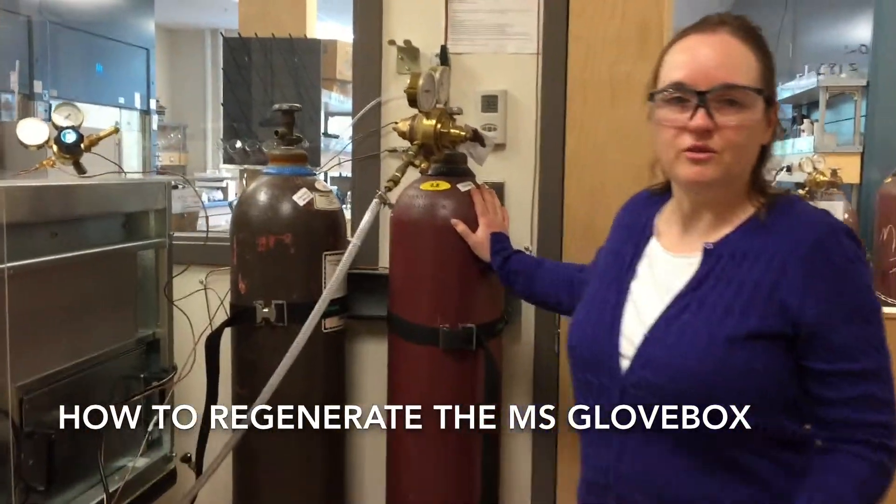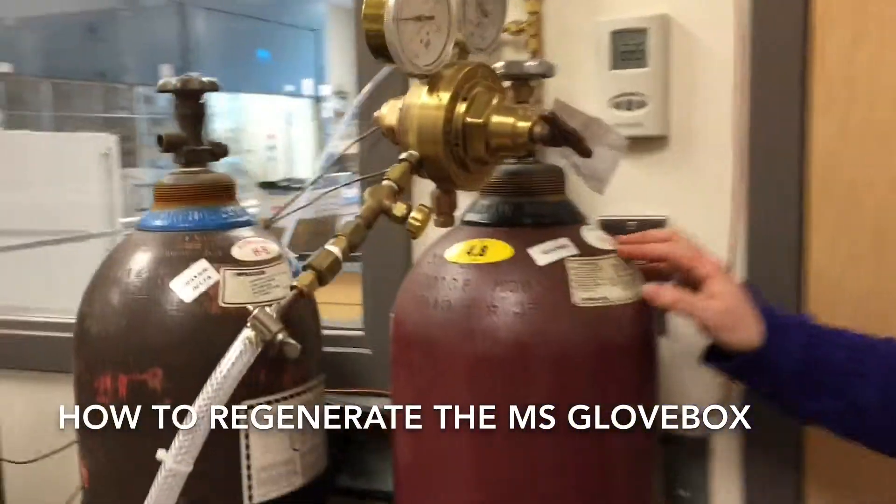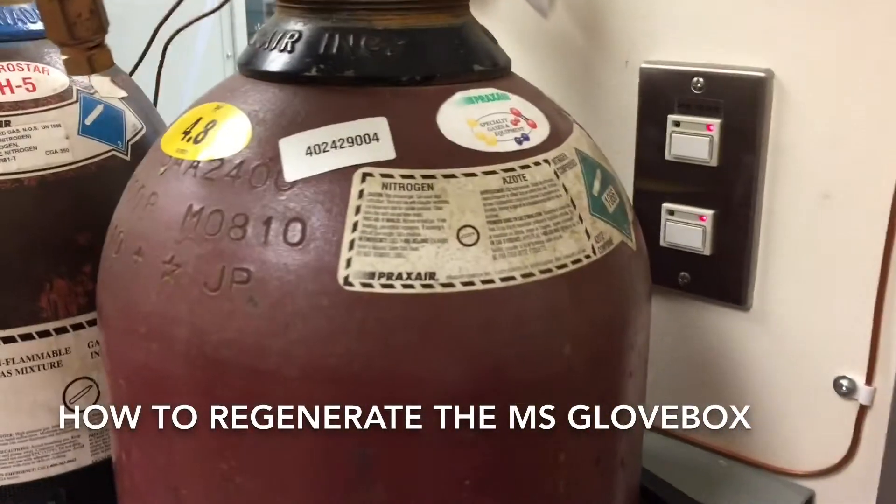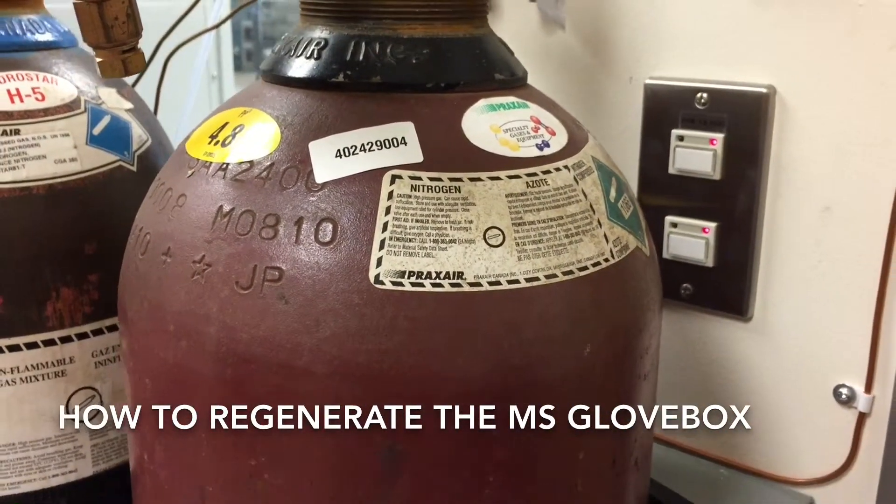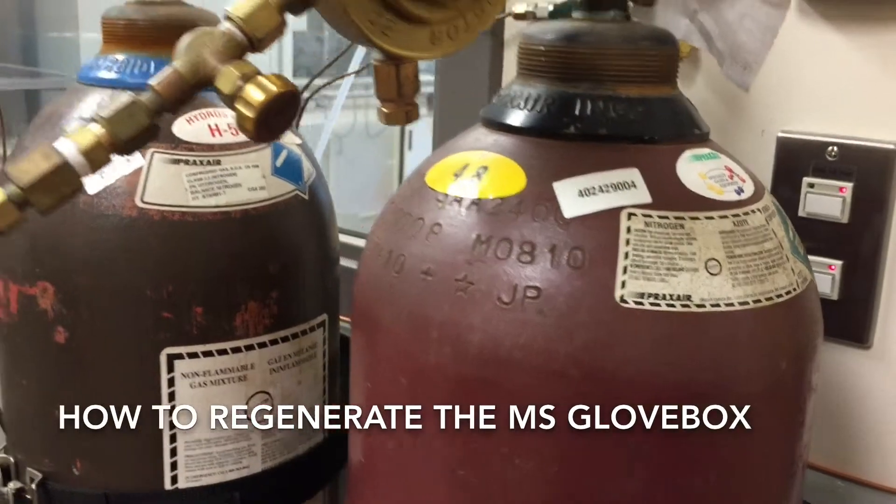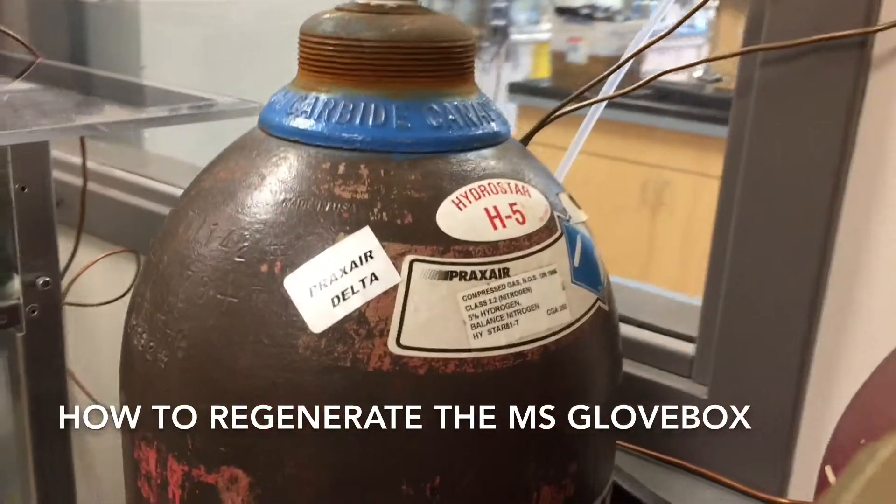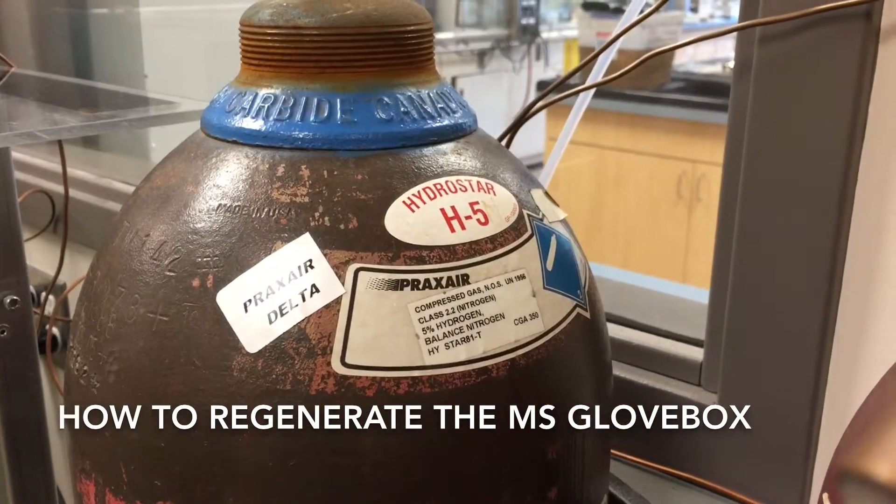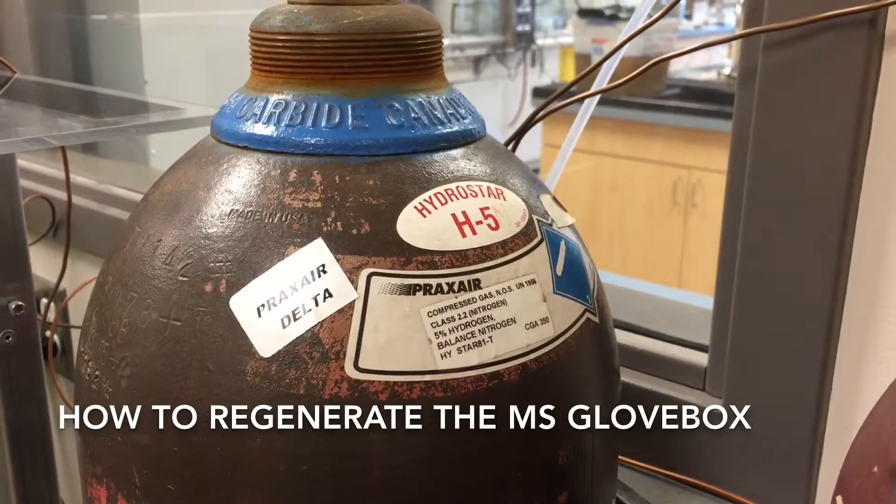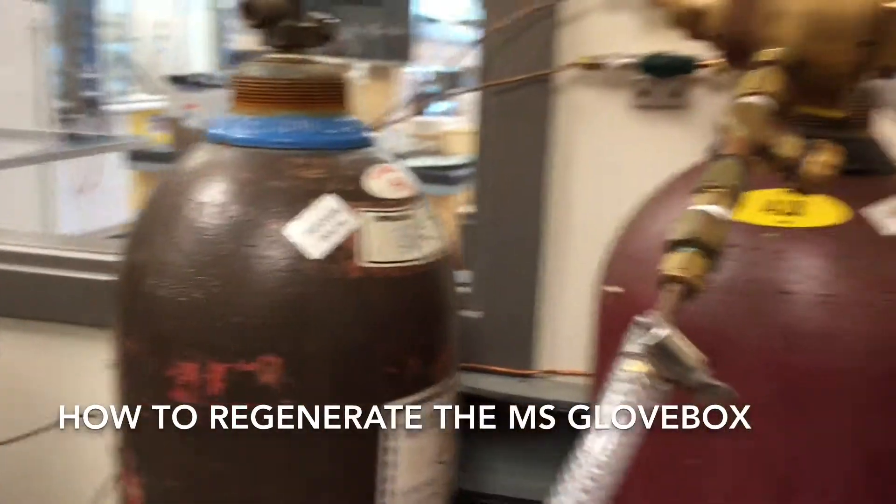It's always hooked up to this gas. This is 4.8 nitrogen, and we're going to also need that one for the regeneration. And next to it we have the H5N gas, and that means that it's 5% hydrogen with the rest being nitrogen.